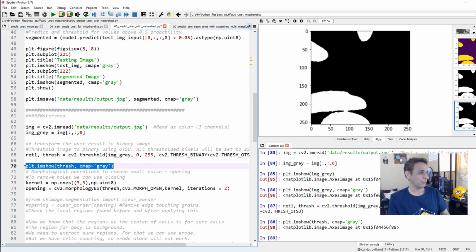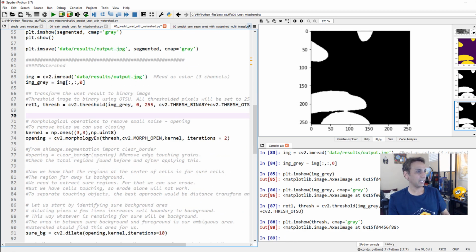Okay, now what? Now let's define a kernel and perform some opening operation. I'm showing all of these even though my image doesn't need this. I'm pretty sure most images require this, and that's exactly why I'm covering this. Here I'm doing morphological opening, an image processing operation. If I have a pixel here, a pixel there, that it thinks are mitochondria pixels, this is a great way of cleaning it up.